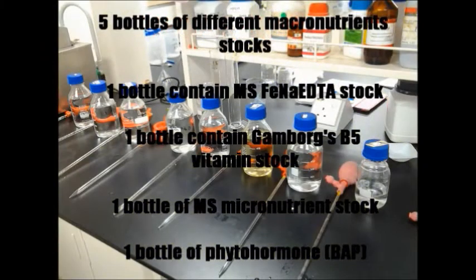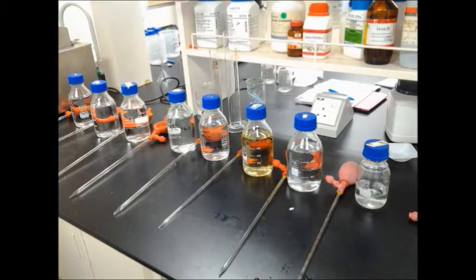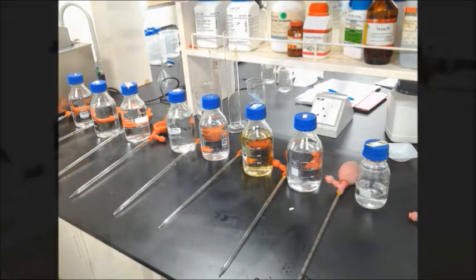In preparing the medium, the Murashige and Skoog medium, also known as MS medium, is used. Another important media formulation is the Gamborg B5, which is also included. To prepare a half MS medium, 5 ml of each of the MS macronutrients — namely ammonium nitrate, potassium nitrate, calcium chloride, magnesium sulfate, and monopotassium phosphate — was added into a plastic beaker.